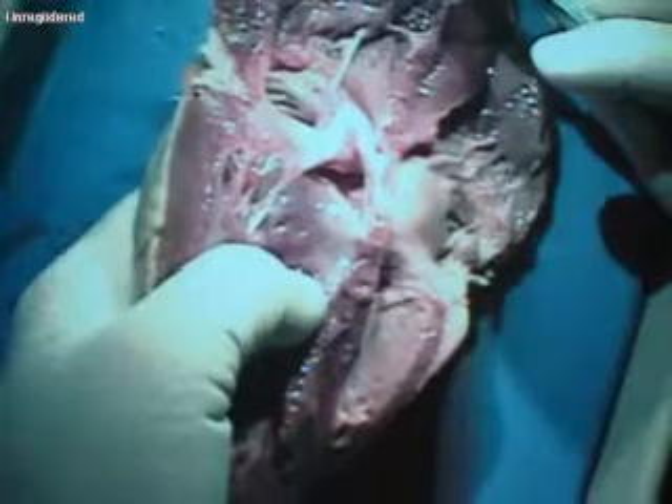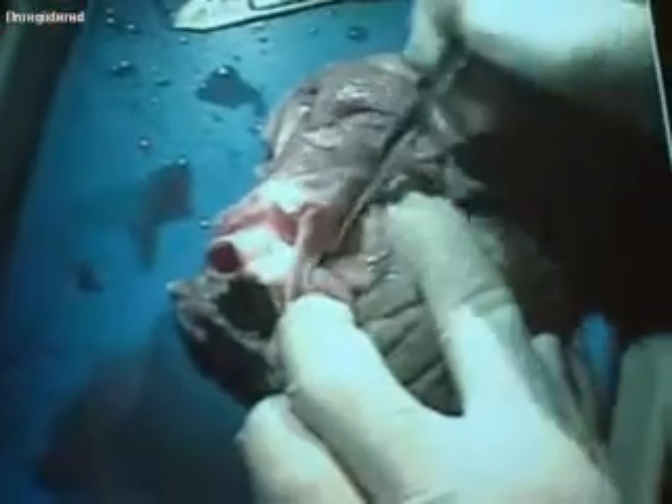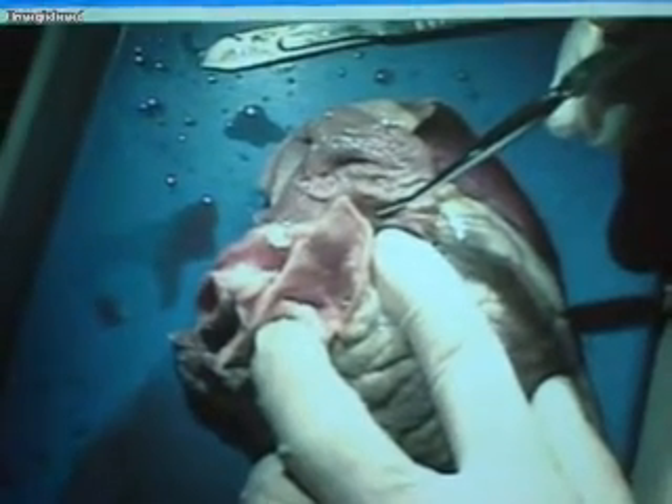And I think those are all the structures you need to know — check in your book to confirm. The ligamentum arteriosum I don't see here; it's between the pulmonary arteries and the aortic arch but the aorta isn't long enough on these specimens. So I don't see it on anybody. Anything else? Can we cover all of the heart? One more time starting from the front — go to the right side, the anterior longitudinal.